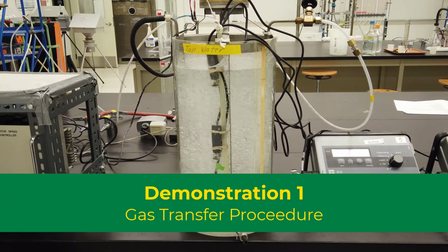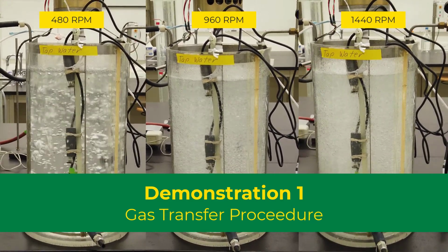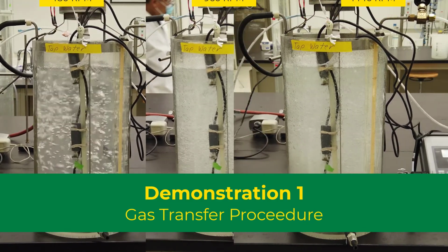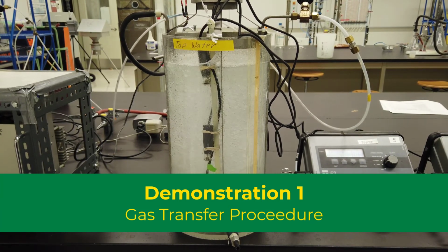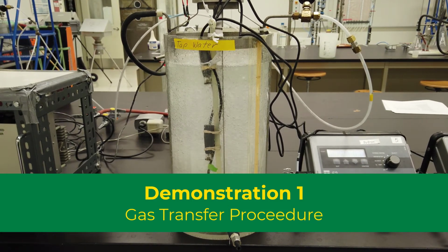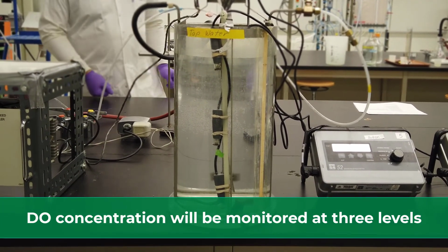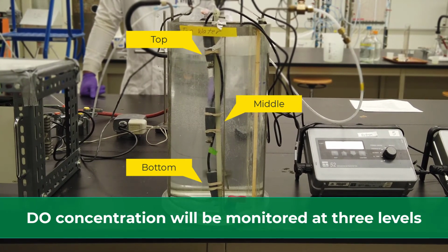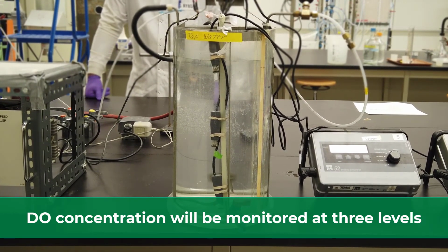Each group will examine the gas transfer characteristics at 3 different mixing speeds: 480 RPM, 960 RPM, and 1440 RPM, in one of the 3 water samples: tap water, primary effluent, and secondary effluent. Each group will perform a single run with each speed. Results from all groups will be pooled as class data. Dissolved oxygen concentrations will be monitored at 3 levels within the test chamber, the top, middle, and bottom, to create a vertical profile. The DO meters have been calibrated with respect to ambient temperature and pressure.